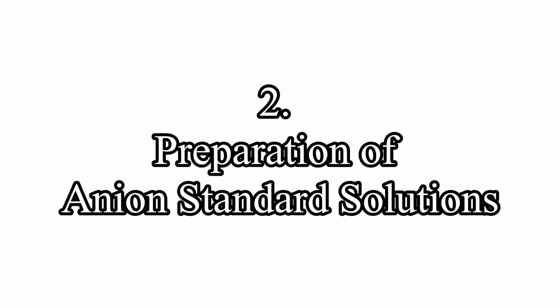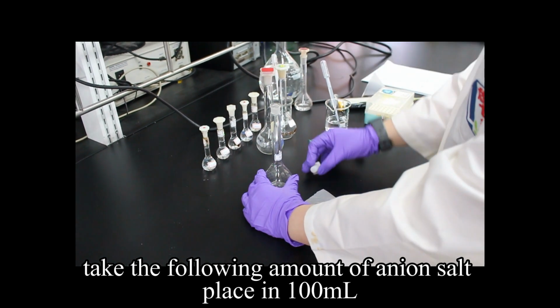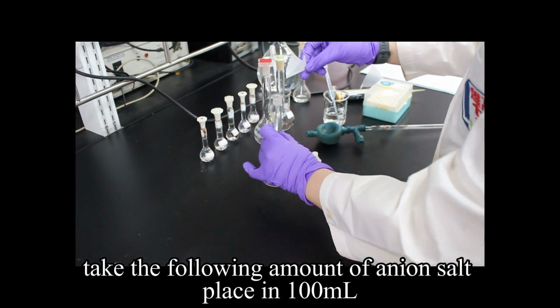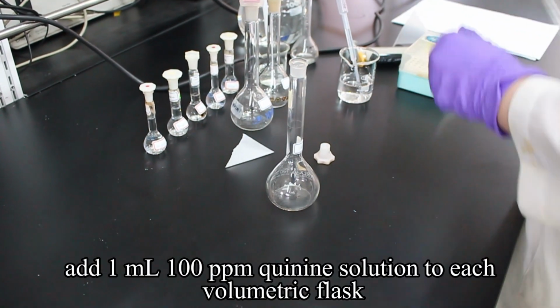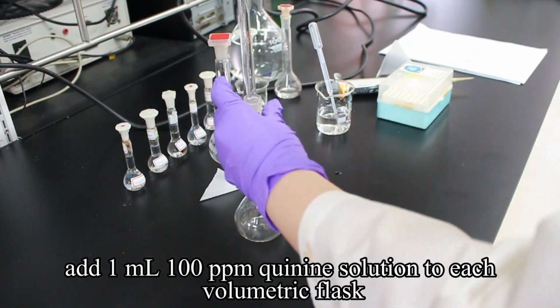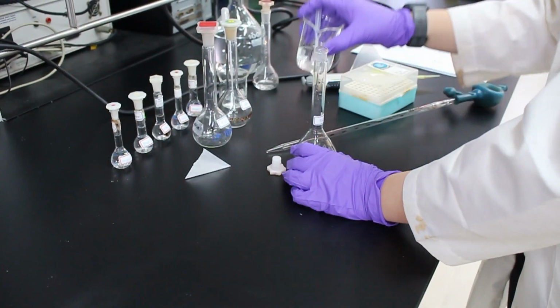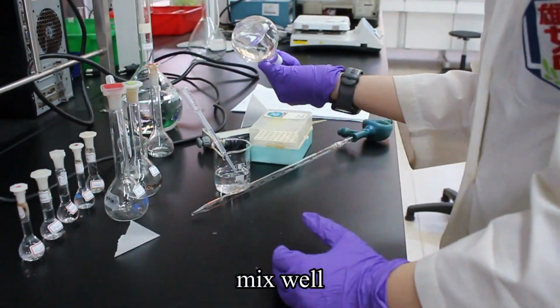Step 2, preparation of anion standard solutions. Part A, prepare 100 ppm fluoride, chloride, and bromide solutions. Take the following amount of anion salt, and place in 100 ml volumetric flasks, respectively. Add 1 ml 100 ppm quinine solution to each volumetric flask. Then add dilute sulfuric acid to the mark. Mix well.